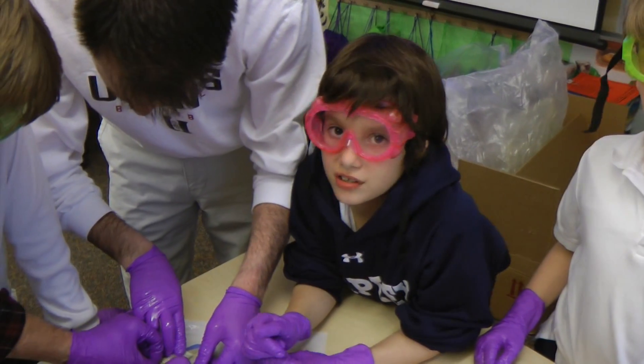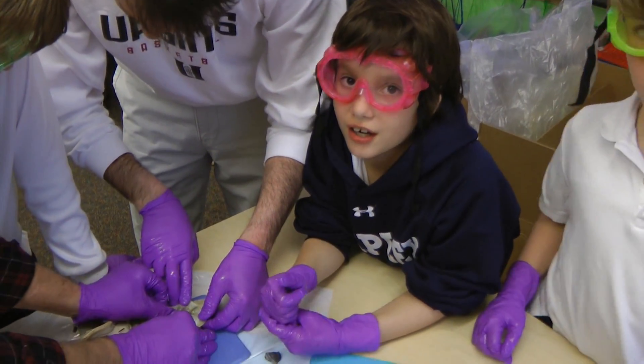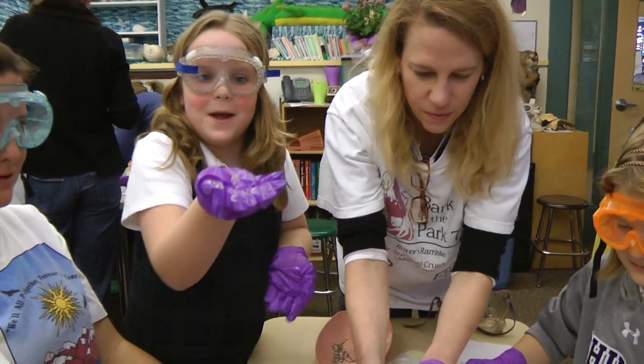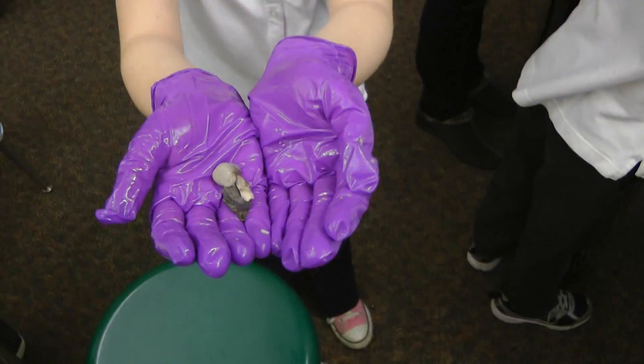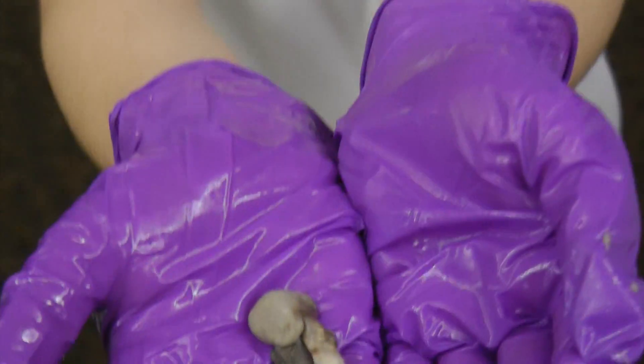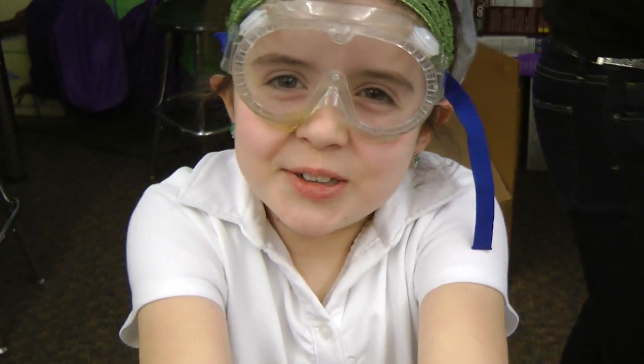The brain wouldn't be up there, we don't think. But you never know because it's not a human we're dissecting — it's a shark. I want to touch the brain. First we took out the eyeball, then the pupil. Me and Vicki just cut out the heart. It was kind of disgusting, but it was worth it.